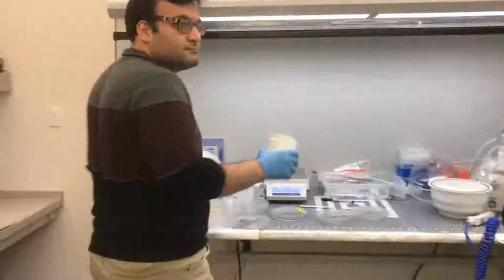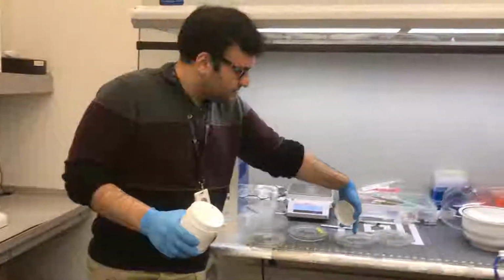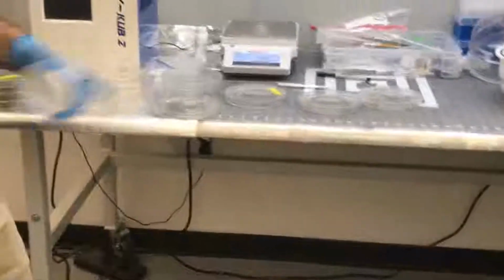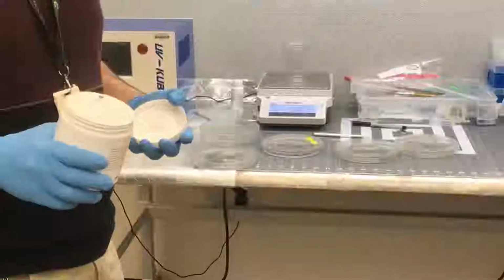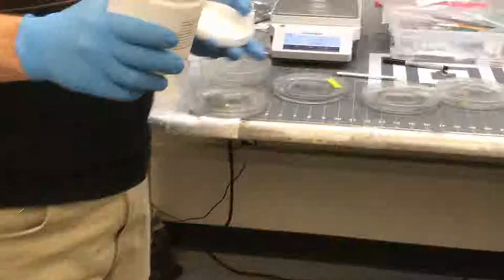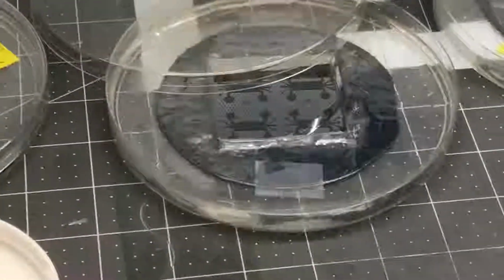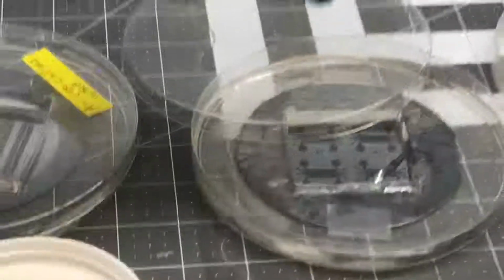And then how do you determine the amount you are going to add? It depends on the size. Based on the size of your chip, then you will add it to the structure. For example, for these two, we added 15 gram of the PDMS. Okay, so that's my question. How did you decide these two? This is based on the experiment.